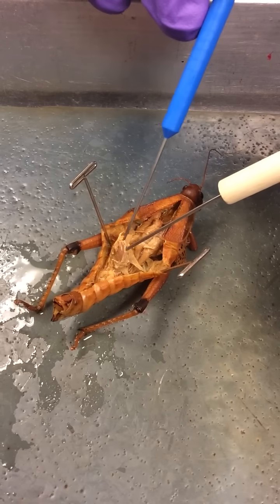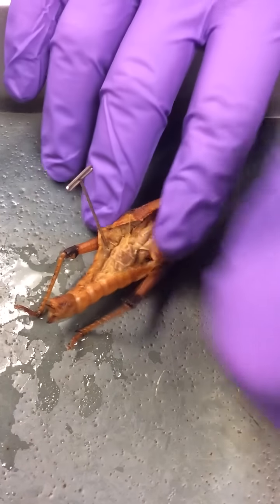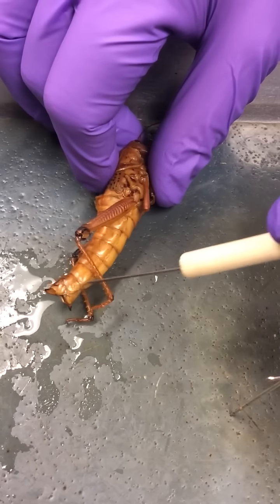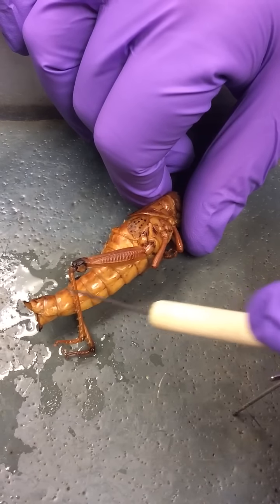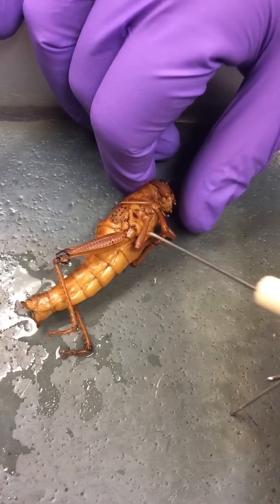If we go over here and peek underneath the reproductive organs, we can find all these little strings. Those are Malpighian tubules. In terms of internal anatomy, that's all we have for the grasshopper. Starting with external anatomy, we find ourselves working posteriorly with the ovipositor. The abdomen starts at this location and goes posteriorly. We have terga, or a single tergum, and sterna, or singular sternum, where we have a spiracle.